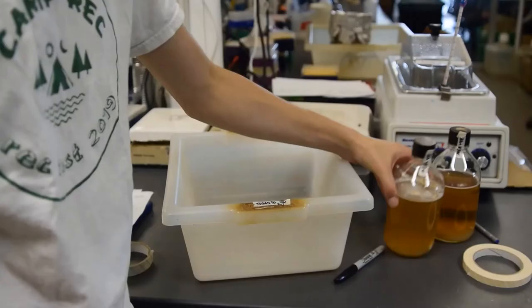Then we're going to label the autoclave bin with the lab, the autoclave cycle, in this case two, and your name abbreviation or your initials. Place both bottles in.